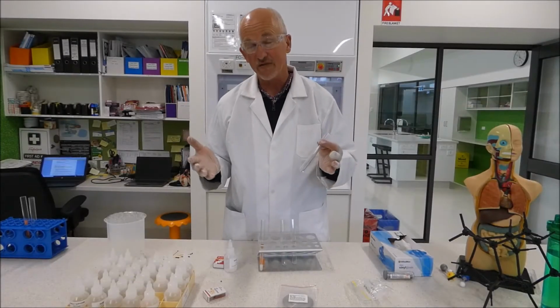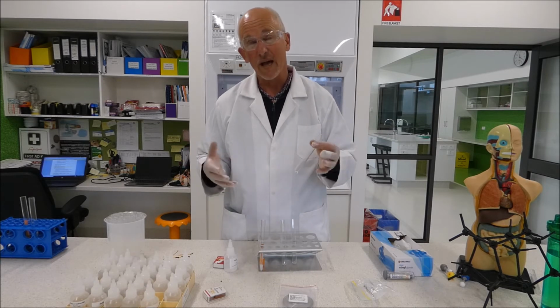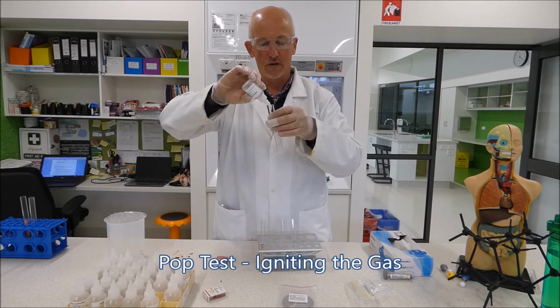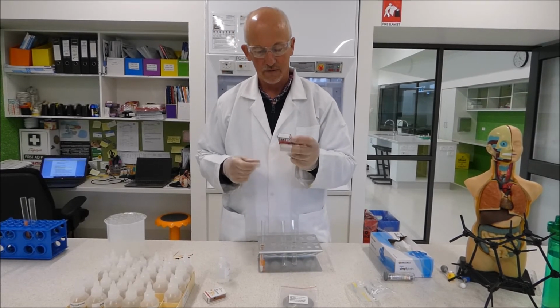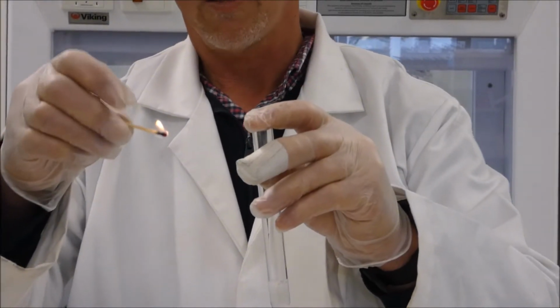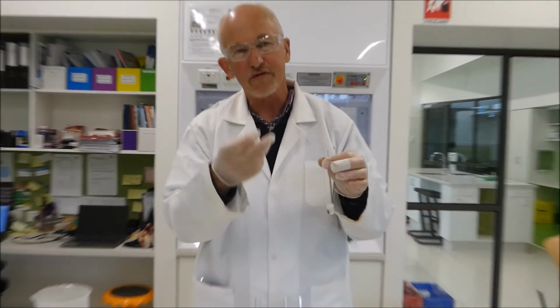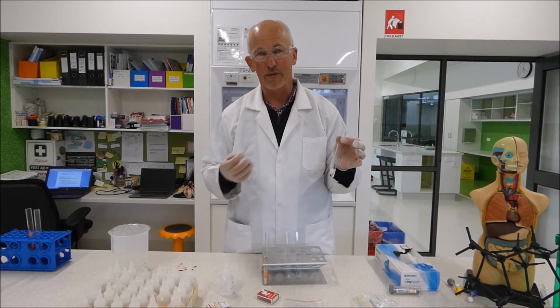So another way we can test for gas being formed with an acid-metal reaction is, because acid-metal reactions often form a flammable gas, to do the pop test. So what we'll do, we'll get our magnesium ribbon in the tube. We shall add some hydrochloric acid. We will get a match, light the match, and we'll hold the match up to the tube, and hopefully you get a bit of a pop. And that's a little bit of flame shooting out of the tube, and that bit of a pop tells you that there's a gas being formed from that reaction.